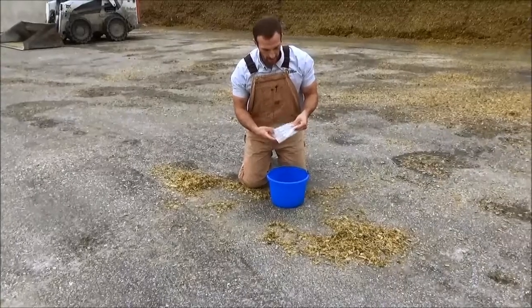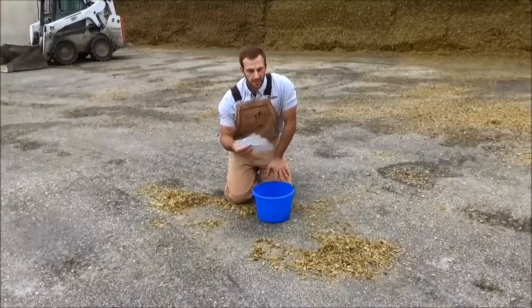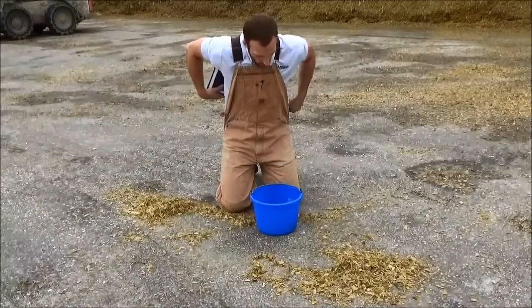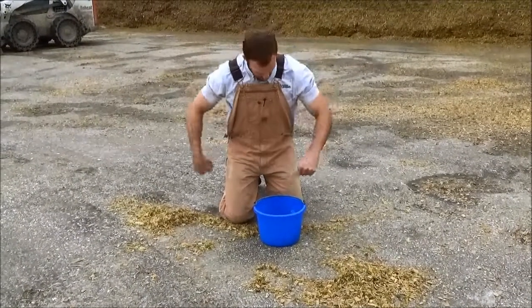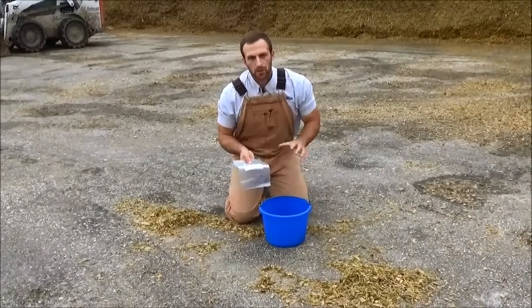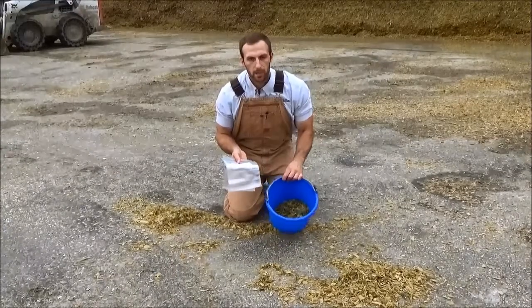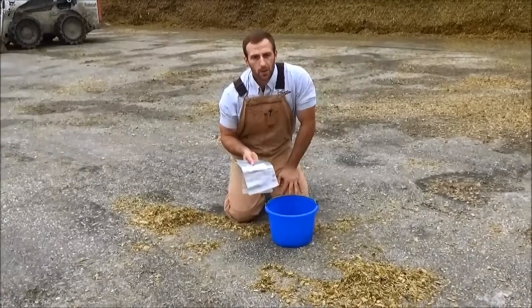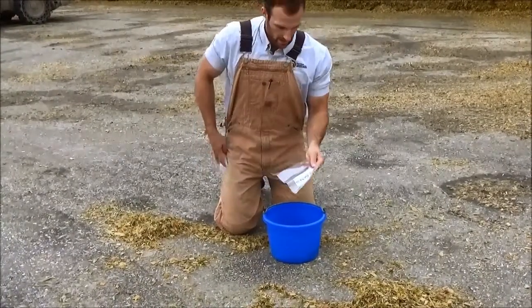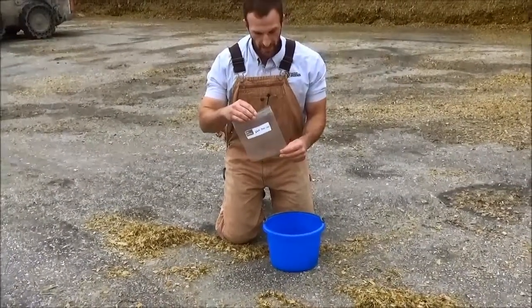I've got several bags that I've pre-labeled. I'll put in a plug for FeedScan — it's a smartphone- or tablet-based application where we can submit information electronically and develop a confirmation code. I've done that ahead of time on these bags, marked in permanent marker, corresponding to the dairy and the feed sample. We want accurate sample information to go along with the sample so we can continue working towards precision. Here's my corn silage sample bag — just a generic quart bag.